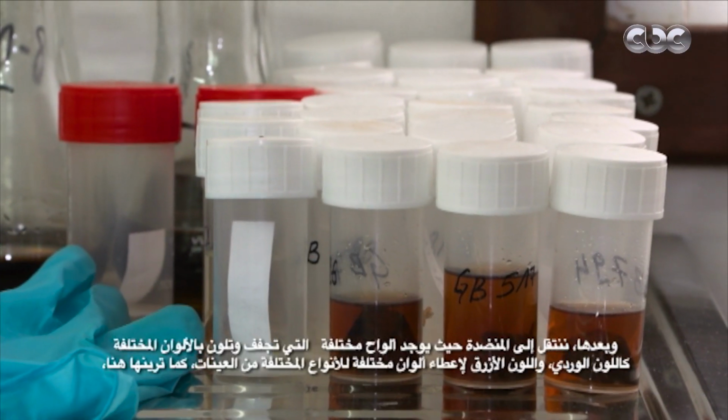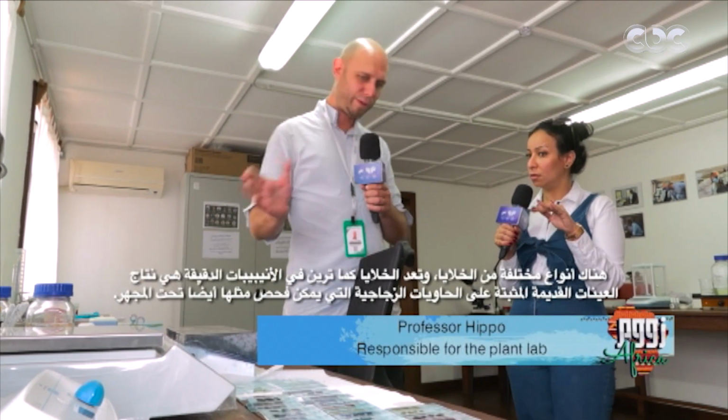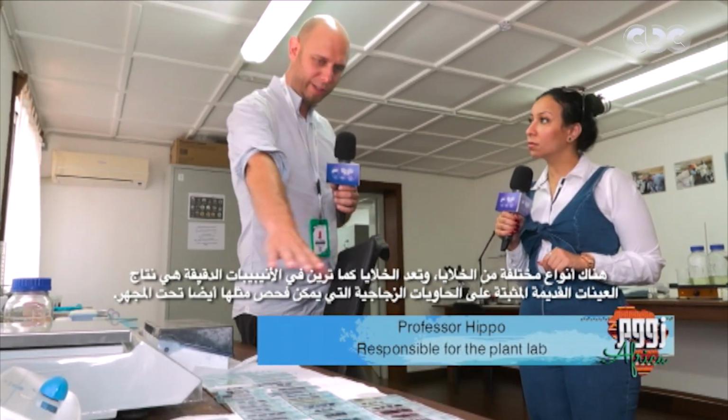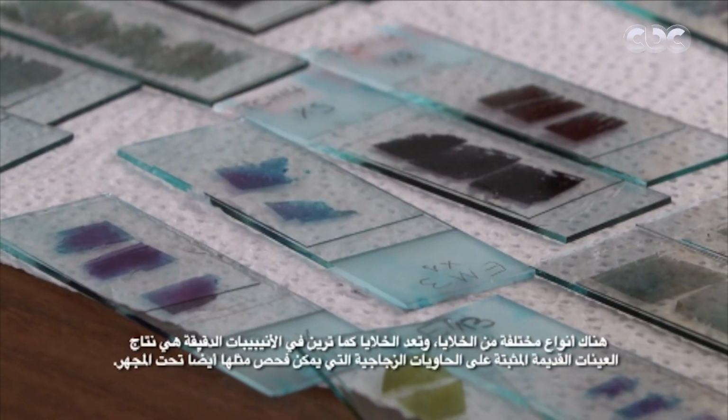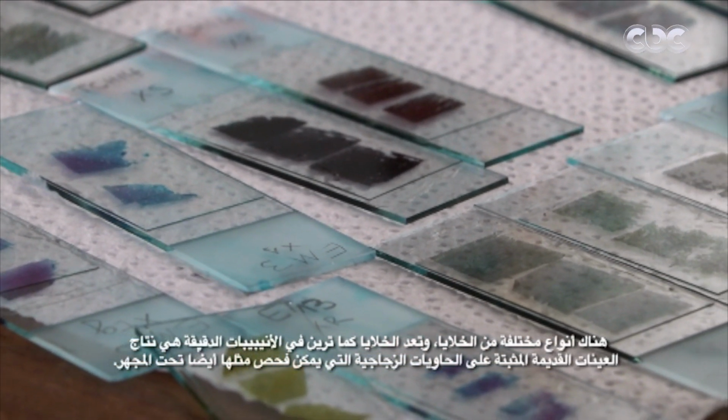After we cut the small thin sections, we first bring them to the different baths to dehydrate them and give them a color. We can give them blue color, we can give them pink color. These different colors are to differentiate the different cell types, so that we can easily see this is this cell type, this is that cell type. The result of which you can see here. What you see here are microscopic thin sections. All the wood samples are fixed on small glass plates that we can put under a microscope.